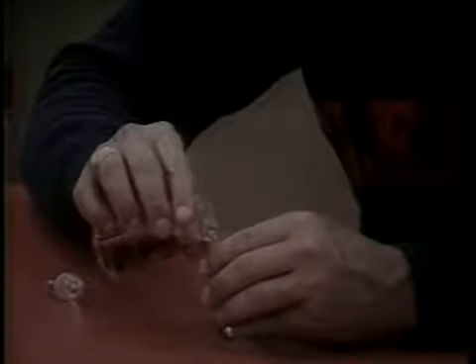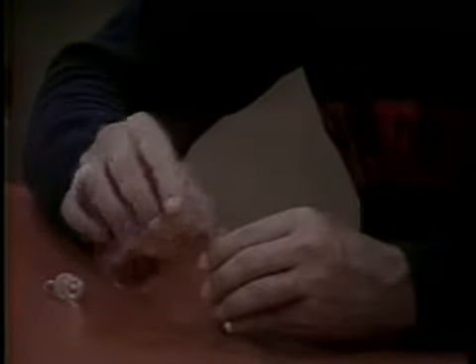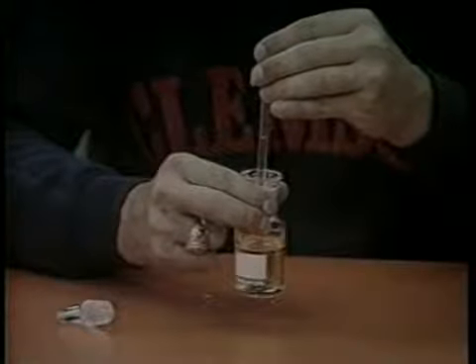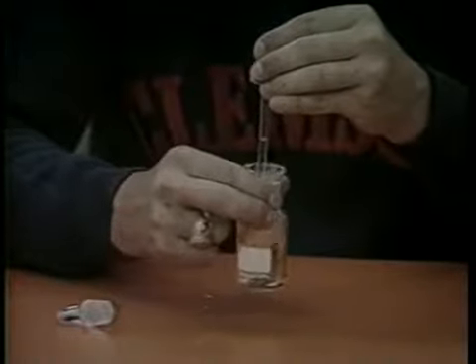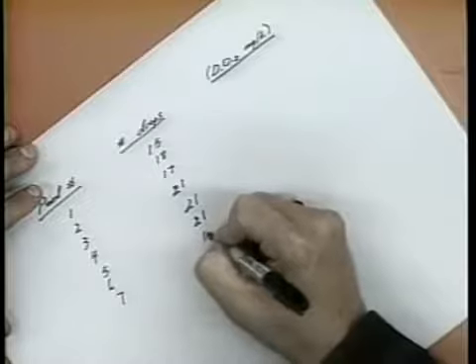Using the prepared sample remaining from the high-range test in the stoppered dissolved oxygen bottle, pour off the excess until the level is at the 30 ml mark on the bottle. Add PAO solution drop by drop until the color changes from yellow to colorless. As in the high-range test, record the number of drops used.